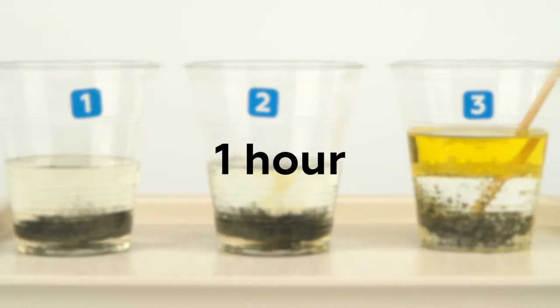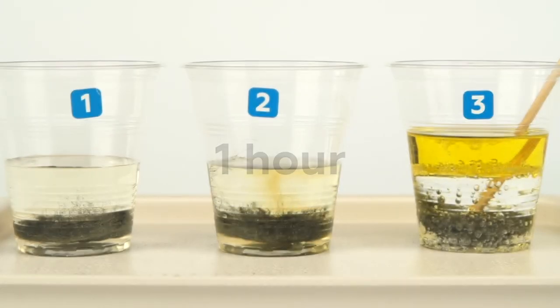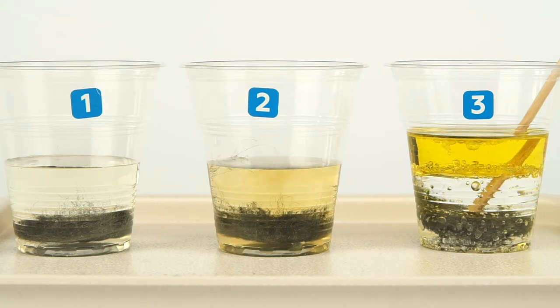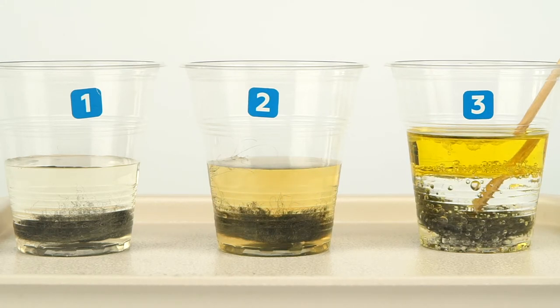Wait one hour, then compare the three cups. The iron wool in the second cup will have rusted, but the iron wool in the first and third cups will remain unchanged.